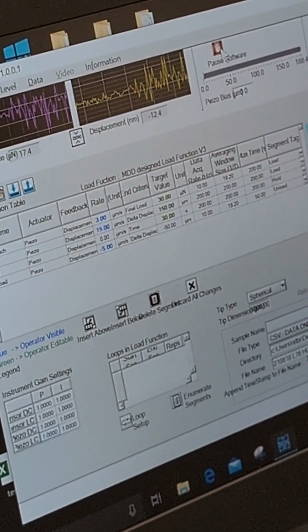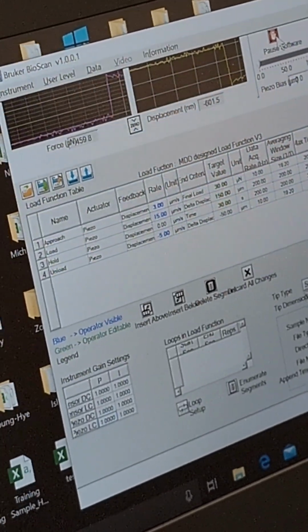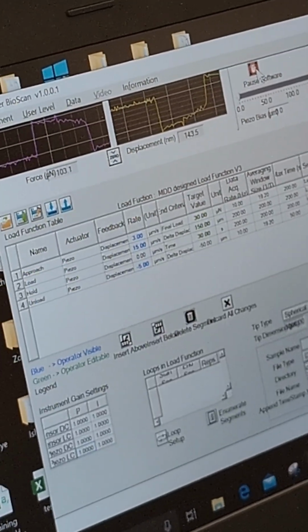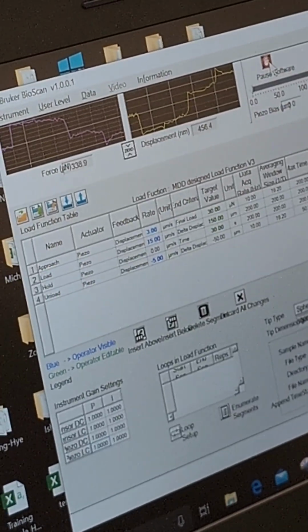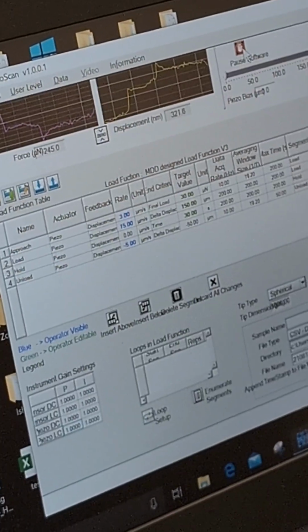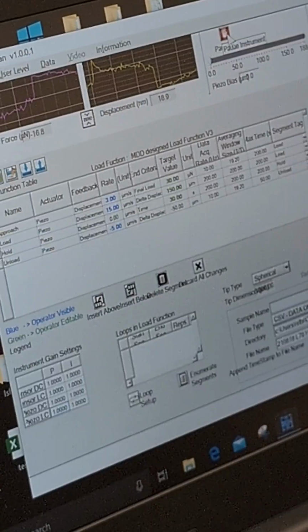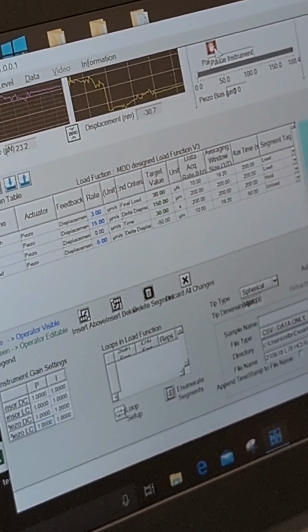Okay. It's already in contact. Go up. So this is now in hard contact. It's not pulling it. It's already indented. So this is the reason why. Oh, I see the negative value there. Okay. So this is another reason if you work with a bigger hydrogel, like in a 96 well plate, it's easier to see. Is this positive? Okay. Let me move up a little bit. Okay, I think this is where I'll just pause. Maybe go up a little bit.